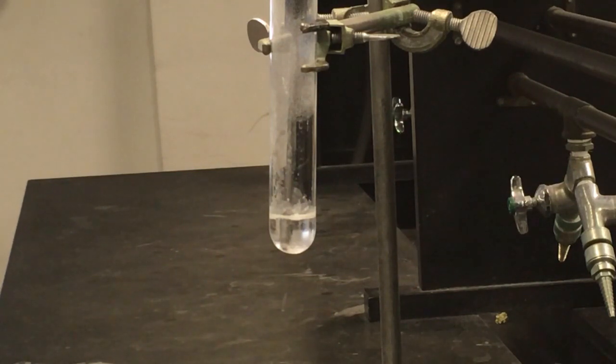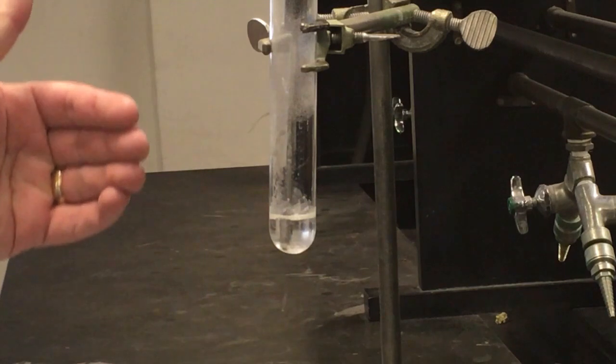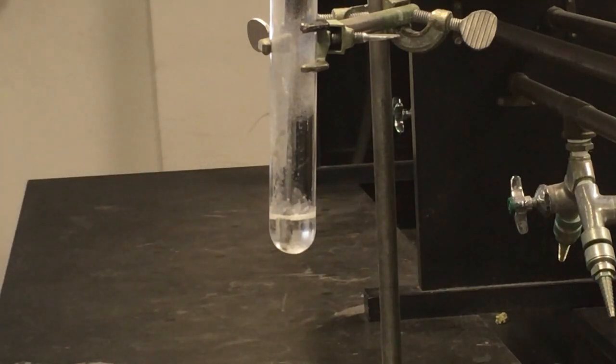And now we're gonna wait and see how long it's gonna take for all of this to completely solidify. And we'll have our plot of data that'll actually show our temperature versus time that I'll also show once things are done cooling. I'm gonna let this keep running for now and let you see the process. The next couple trials, I'll probably skip this cooling process and really just show you the data so that you don't feel like you're just sitting here watching a video while we wait for things to cool down and freeze.